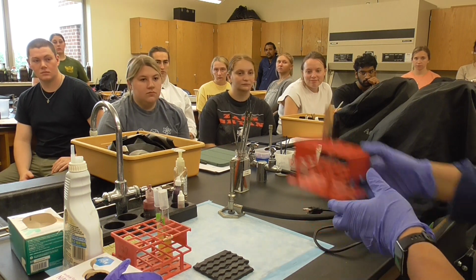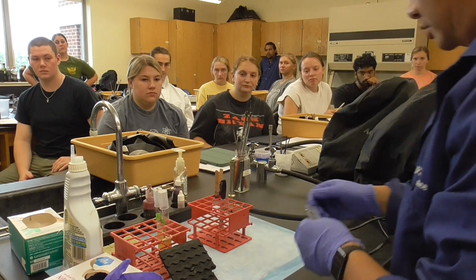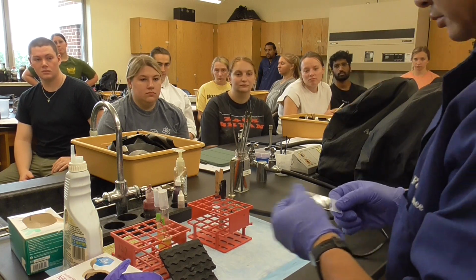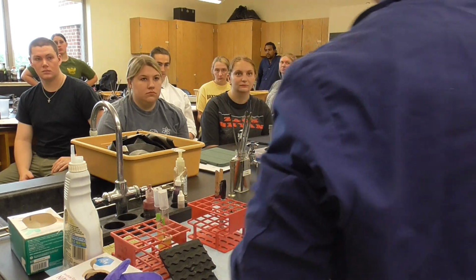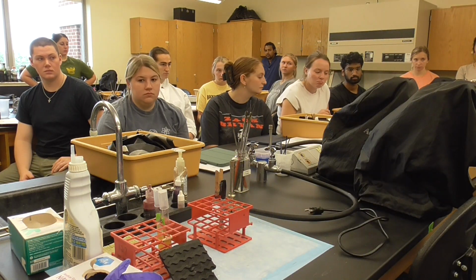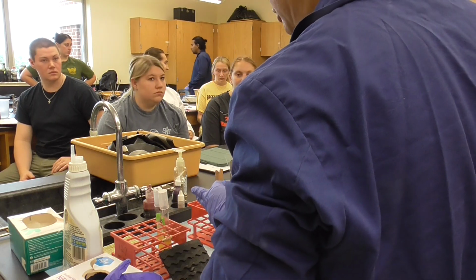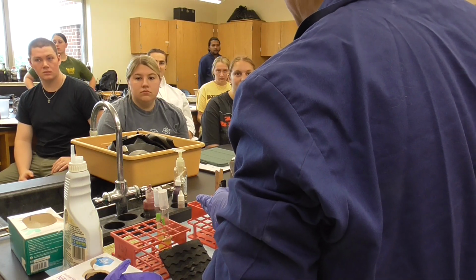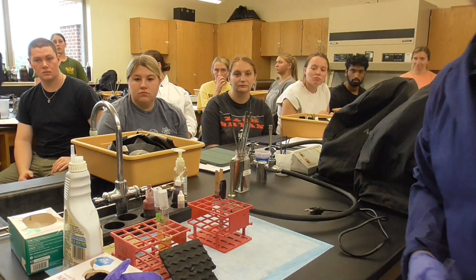So you should have this in your desk. I think this is not really clean. Do we have alcohol on the rim? There is one thing we left, we didn't have it. We need a paper towel.